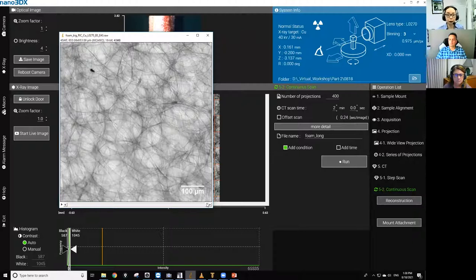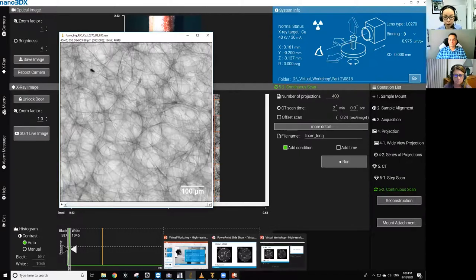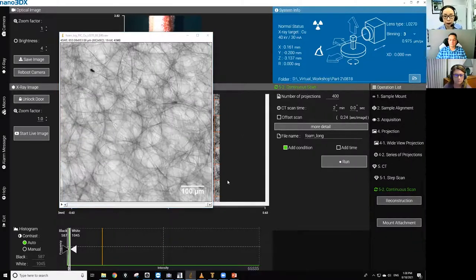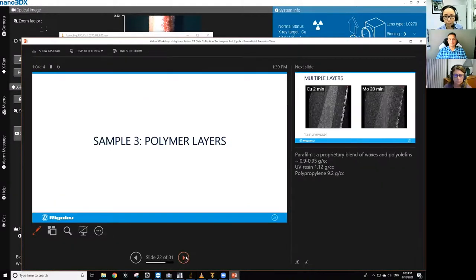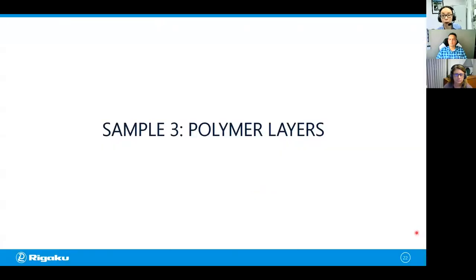If the sample moved in the first 45 minutes of a 20 hour scan, there's a good chance that the first 45 minutes of sample movement is going to ruin your 20 hour scan. So this is something good to check before you commit to a long scan. Okay, so that was about the sample movement, and let's move on to the next sample. By the way, I'm using double-sided tape to hold this foam sample. If you are curious about what other materials you can use to hold those small samples for high resolution scans, that's another topic we covered in part one.